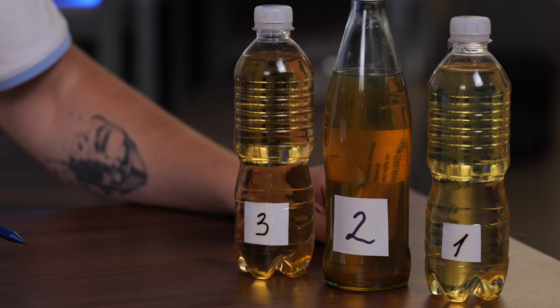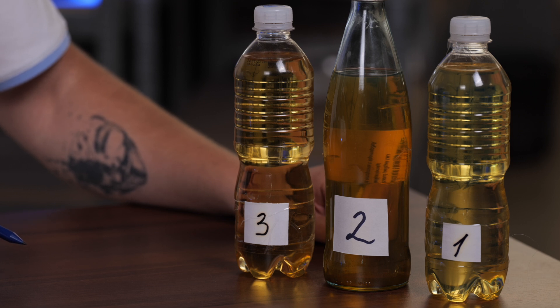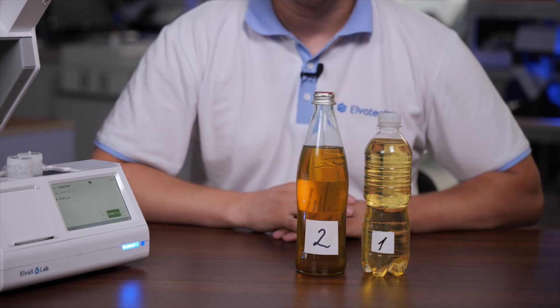Now let's prepare our samples for analysis. We have taken diesel from three different gas stations to compare sulfur levels in each. Each sample was taken with all necessary precautions to ensure accurate results.